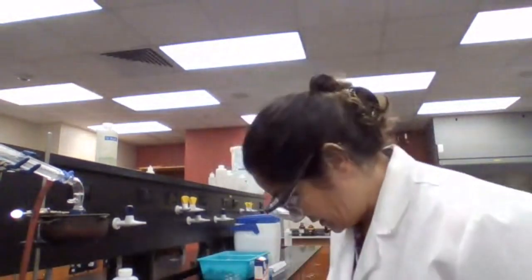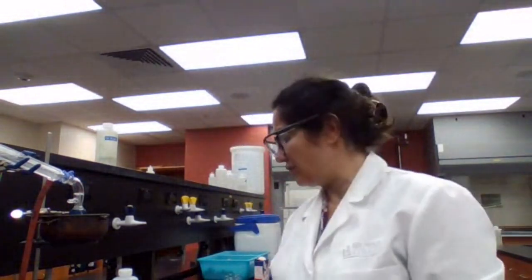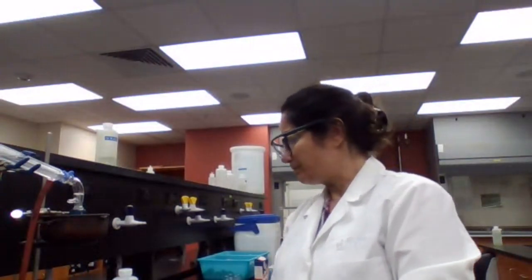Okay, we can wash the flask. What else do we need to do? Just looking for the next step, so I get ready with the equipment and chemicals I need for the following steps, based on the procedure. The distillate goes to the separatory funnel. So that means I have to get extraction equipment ready.